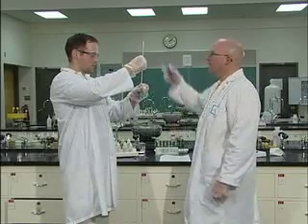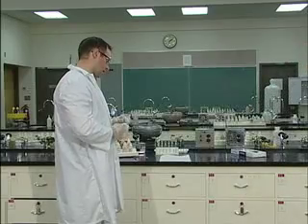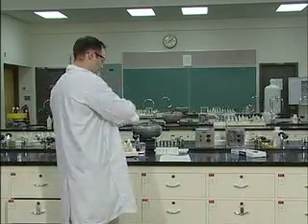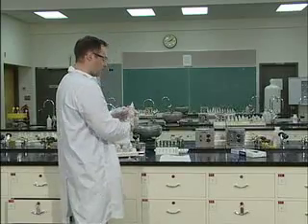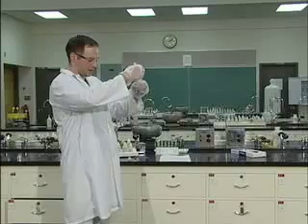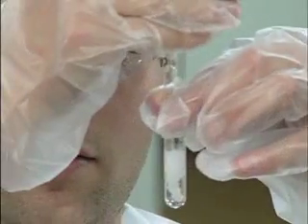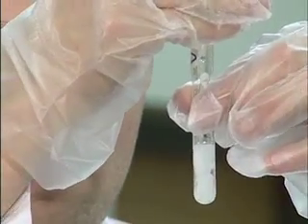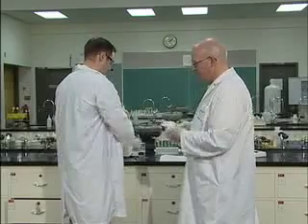Remove the thermometer, clean it. We're going to add to this 15 drops of barium nitrate. Now, judging by what you've seen so far, you should probably be able to figure out the barium nitrate, when you add it in here, is going to do something. Oh, I'm seeing precipitate happening. It's going all white. We get a white precipitate forming.